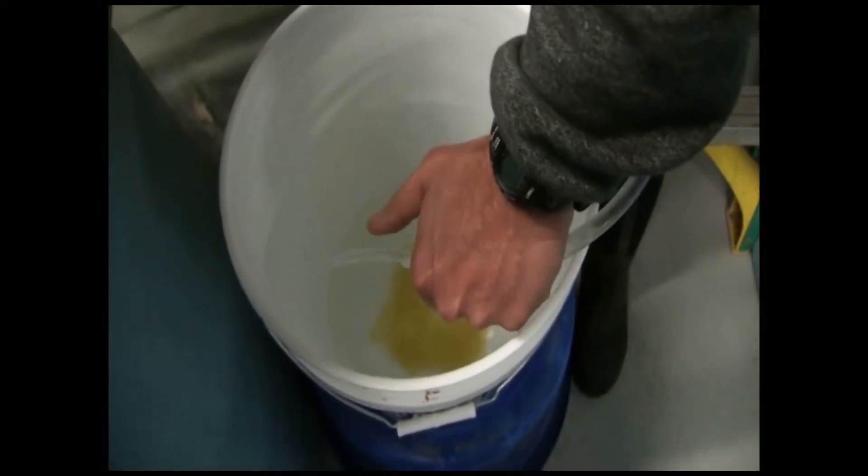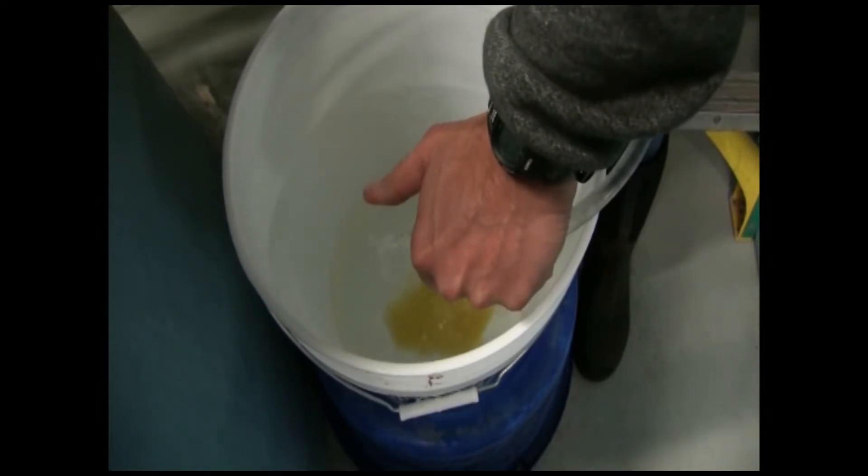Keeping your thumb over the end of the tube is helpful to control starting and stopping the siphoning action.